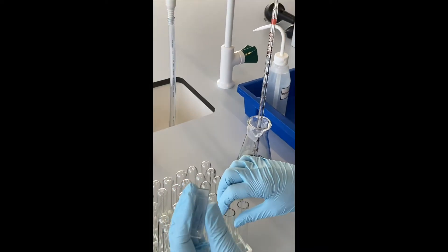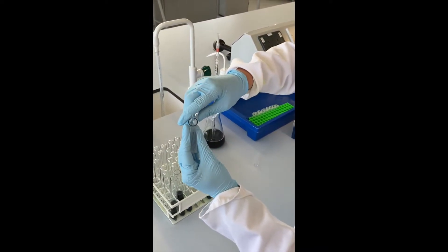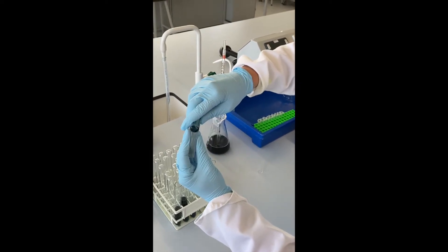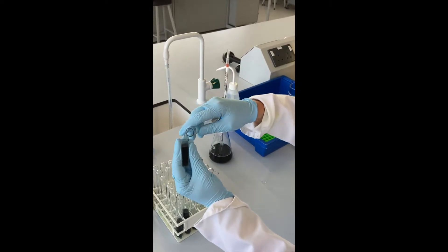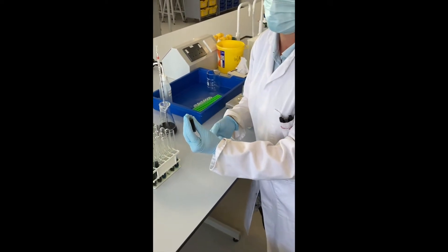Take the solution. The first one will be your blank. This will have everything in your reaction apart from what you're measuring, but that will be replaced by something without it. In this particular case, we're measuring protein. We'll use water because there's no protein in water.